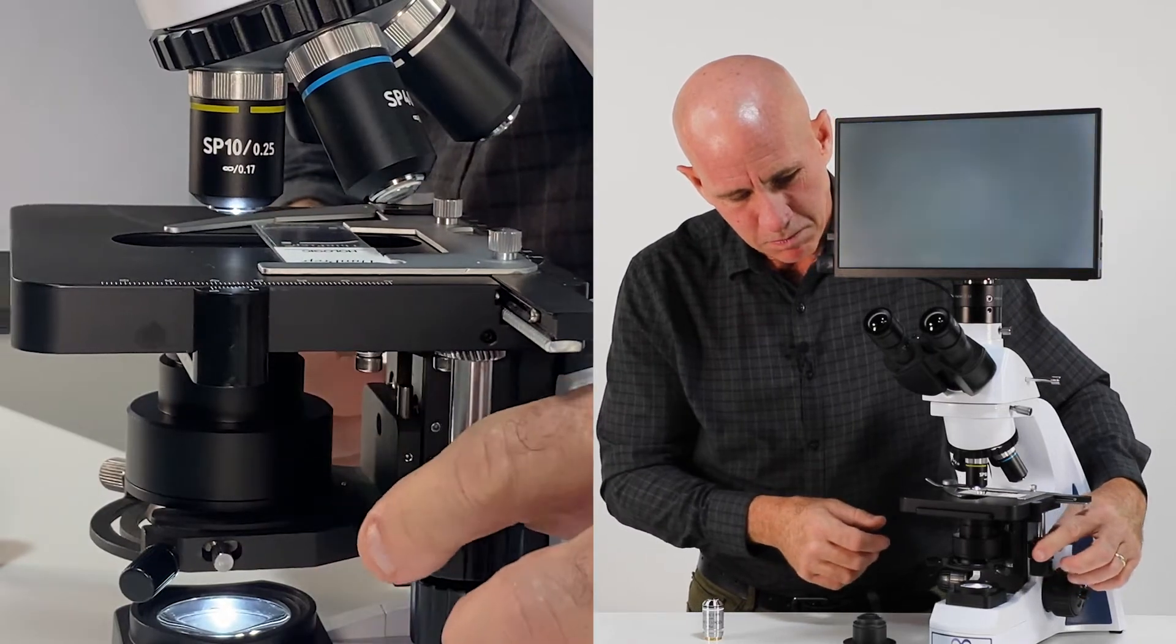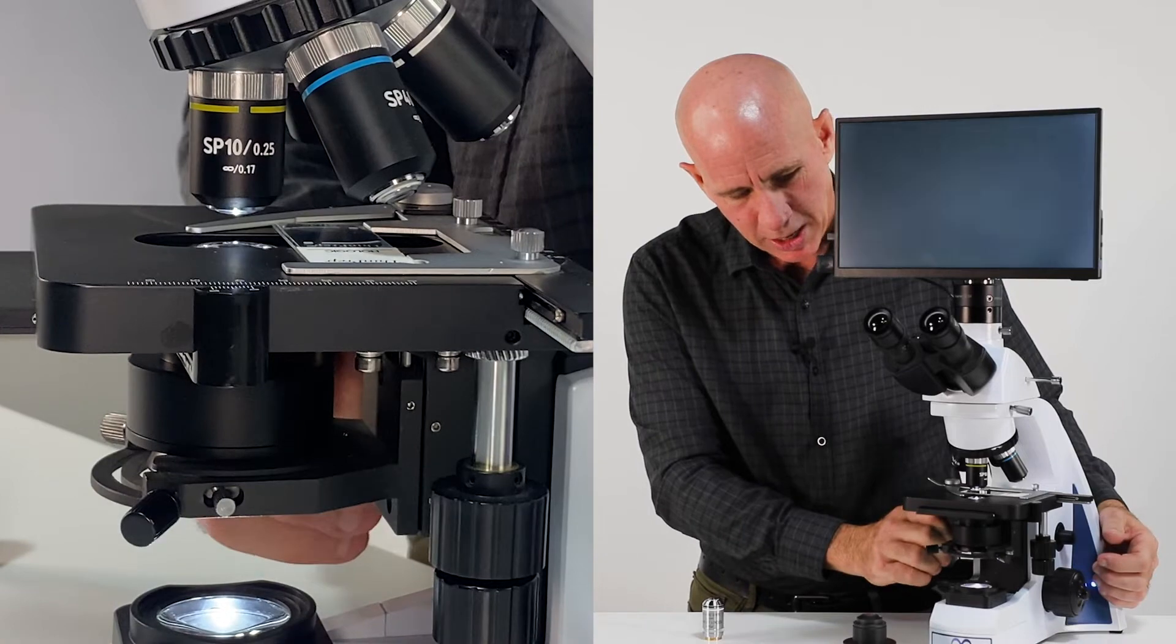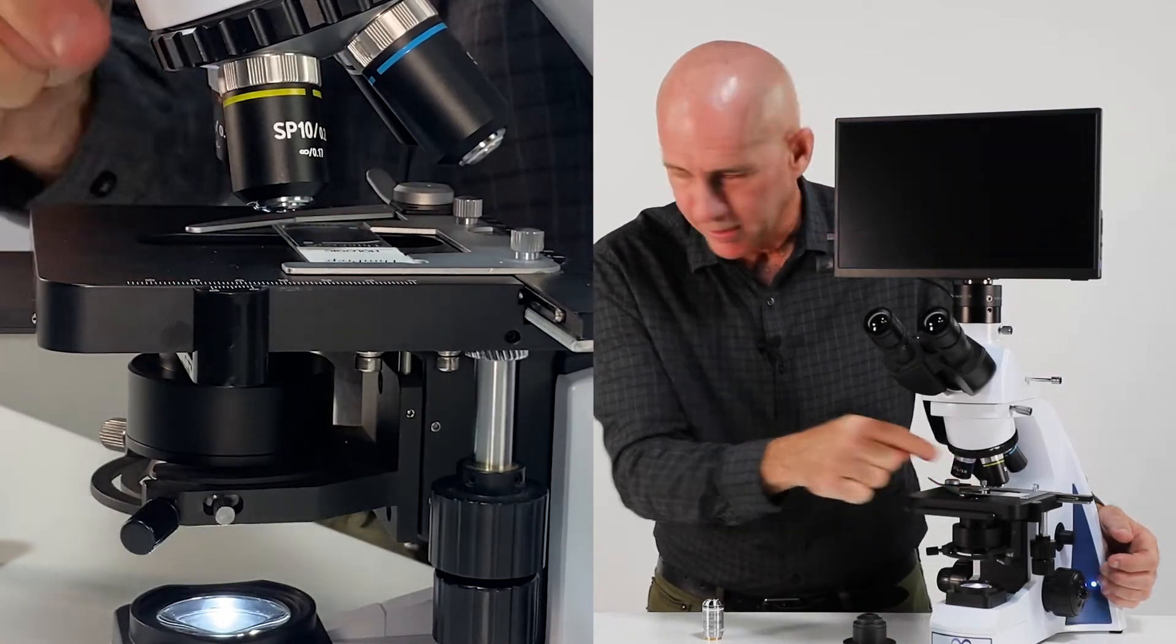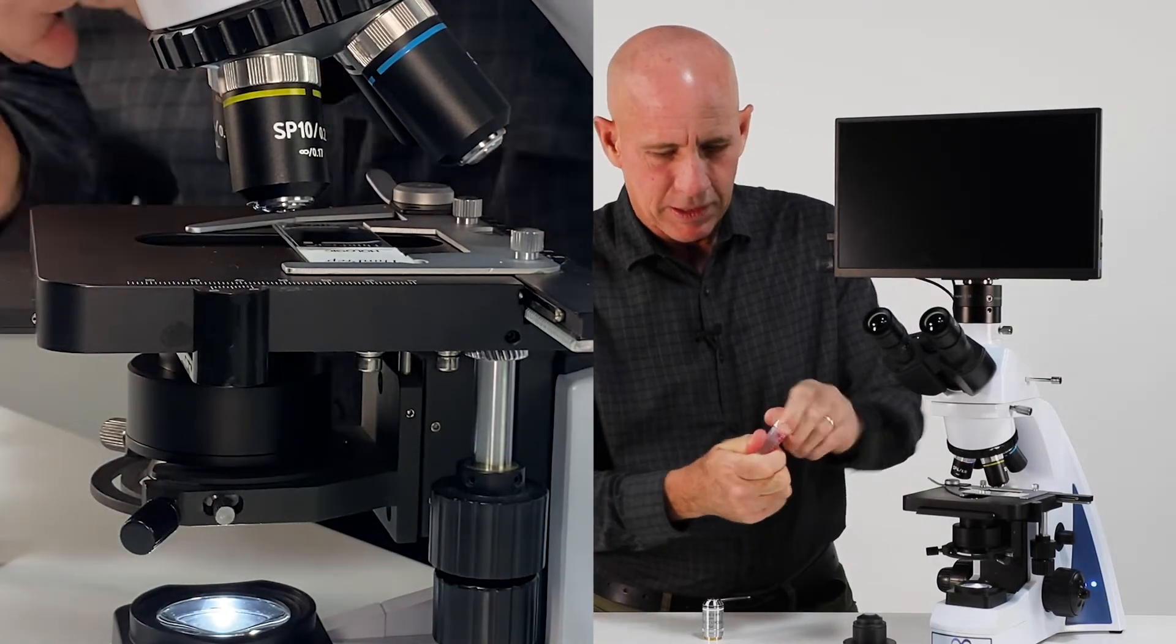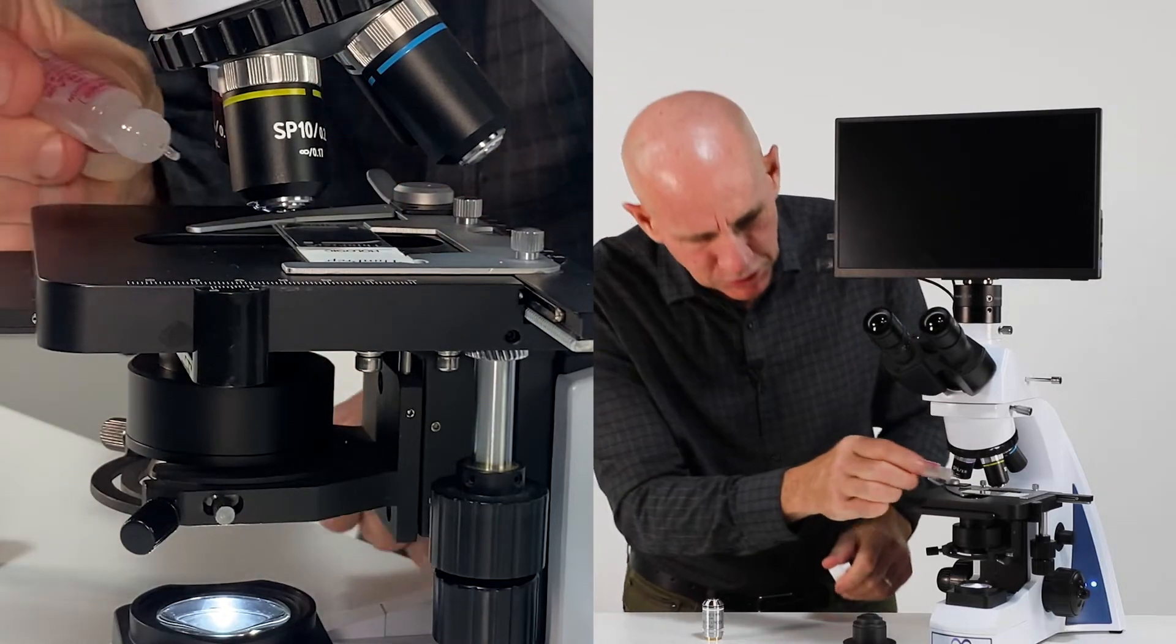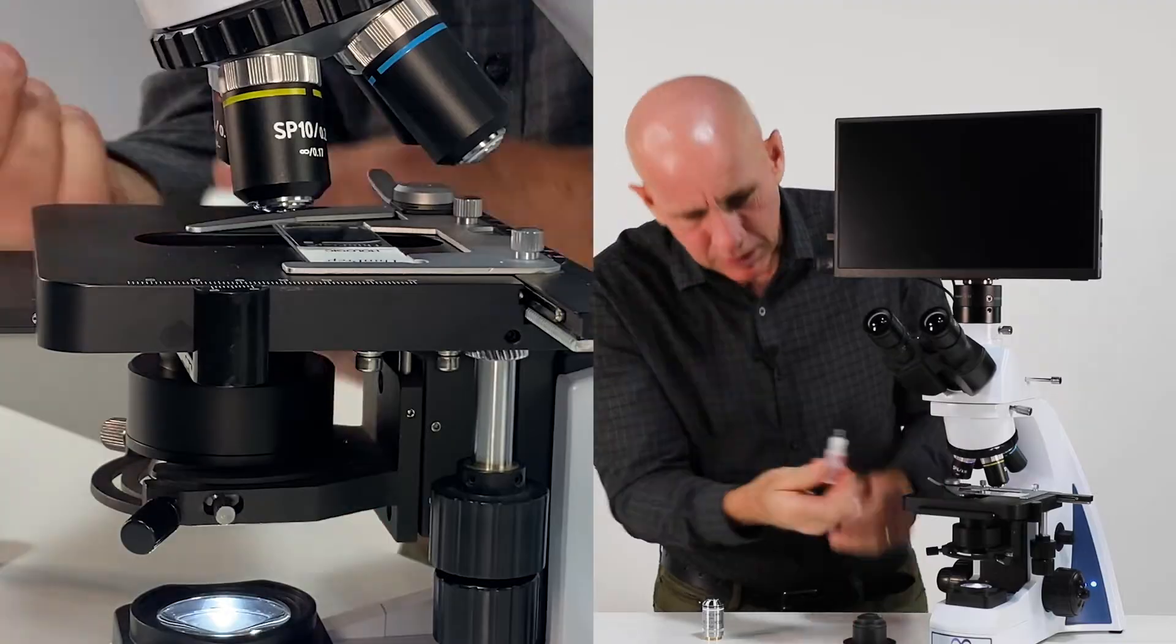I'm going to move my stage, and I'm going to bring my condenser up. Maybe I'll even move my objectives out of the way, so now I have access here. So I'm going to take oil, I'm going to put two drops on top of this condenser. One, two, okay?